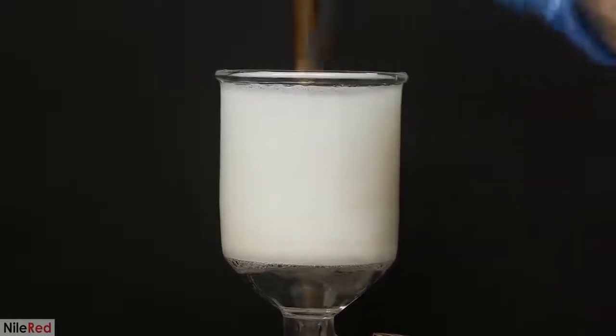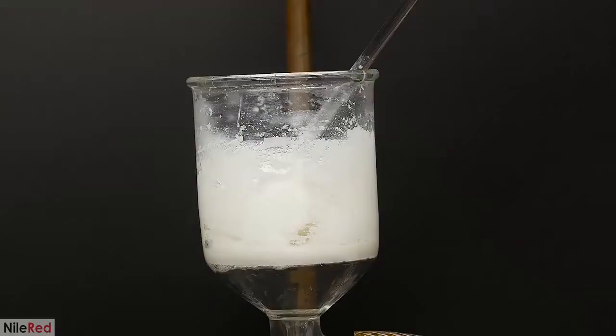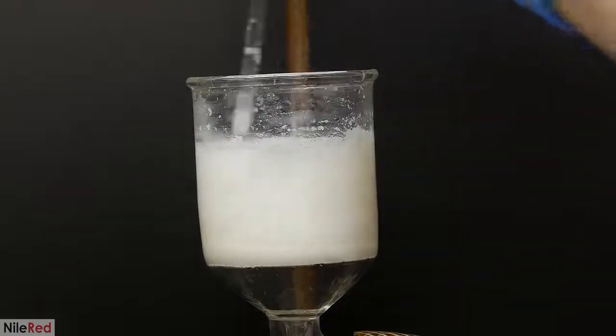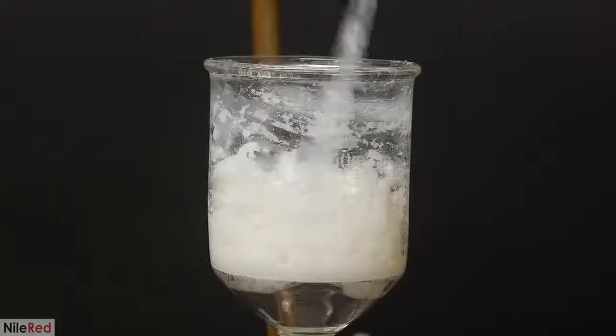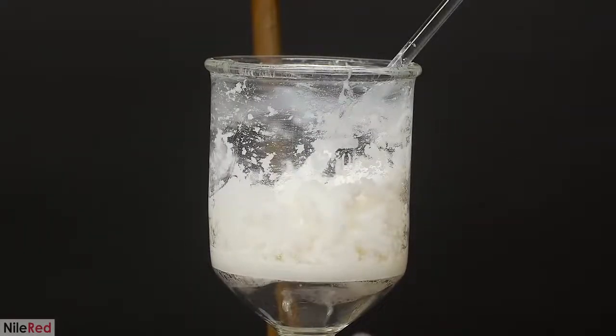And unfortunately, it doesn't go away with just one washing, and it takes several. There's also no way to know exactly how many it'll take. I basically just need to keep doing them and testing the pH of the water that passes through. I know I'm done when the pH paper tells me it's neutral or only slightly acidic. When I get to this point, I stop doing the washes and I leave the pump on to dry it up as much as possible.